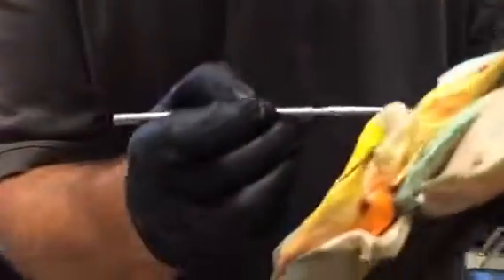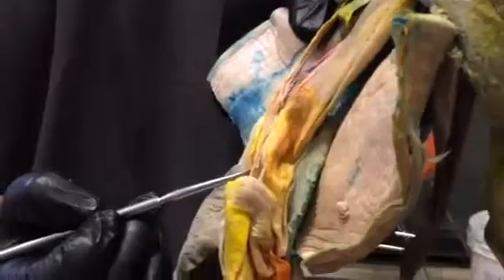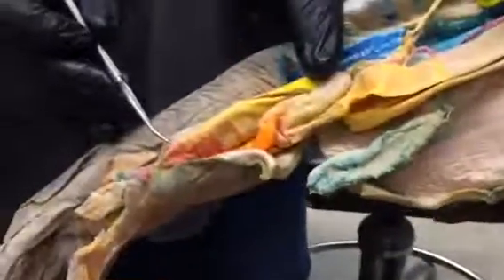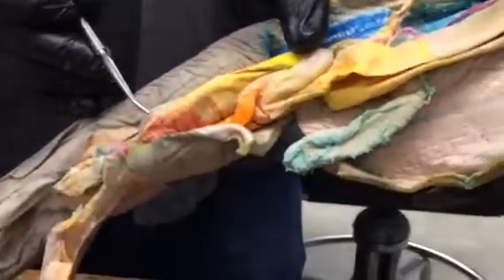Right there is the pancreatico-mesenteric artery. And if we follow that along and back, you're going to see that that pops out onto the surface of the intestine, and that's the anterior intestinal artery. Okay, so it runs along there. That's all one branch off of the celiac artery.